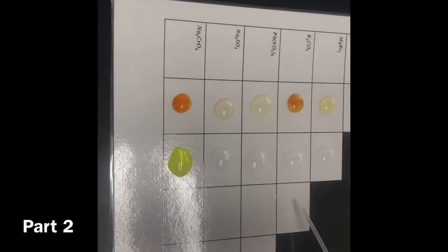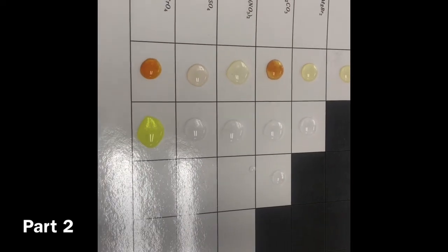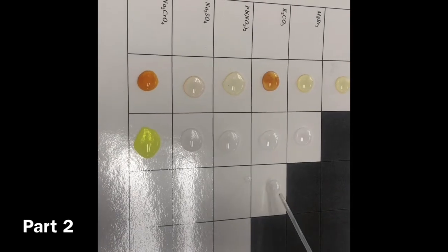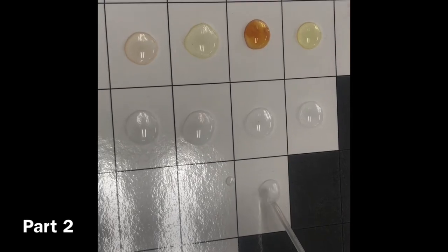Alright, here's the next one. Thank you. So none of those reacted as far as we know. Now we're on magnesium bromide. Okay, and then we got our potassium, which is a K. It's yellow, but don't let that deceive you. This potassium is actually clear. Yes, that is true. Disappointing, but true. Very disappointing. It looked very unreactive.